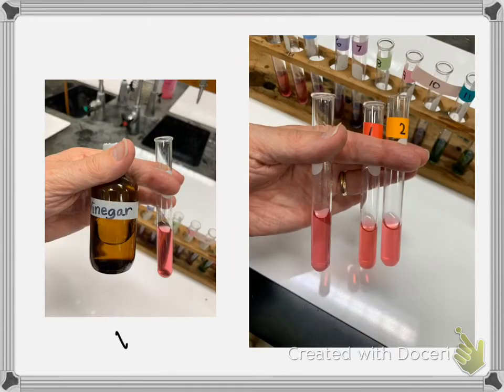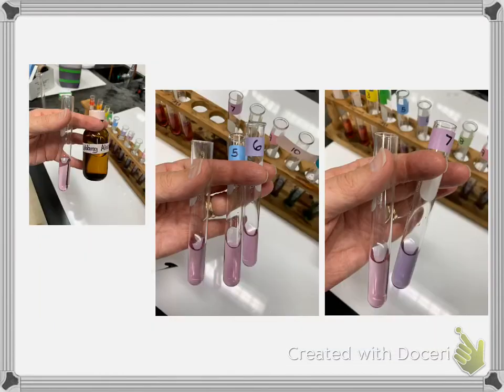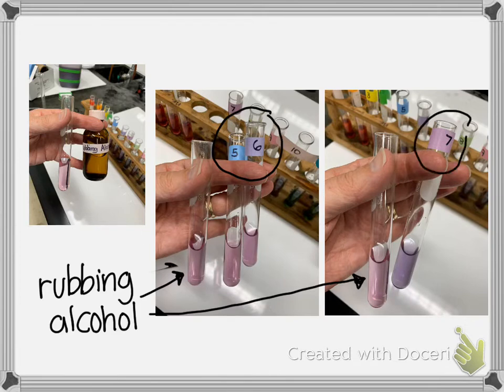This is vinegar. That's the first test tube. And I chose 1 and 2 to compare it to. This is rubbing alcohol. And it's in the first test tube on the left on both examples. And again, I just have two. I chose first 5 and 6, and then I wanted to compare it to 7.